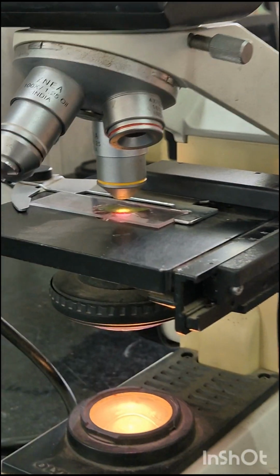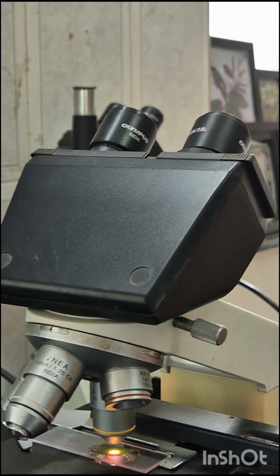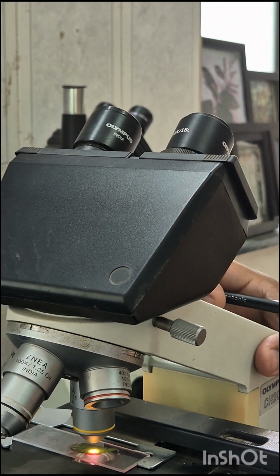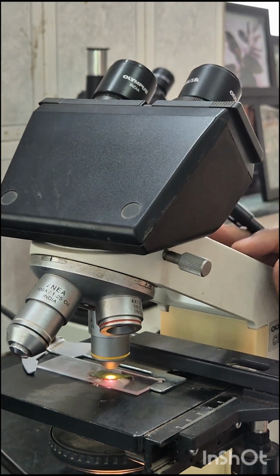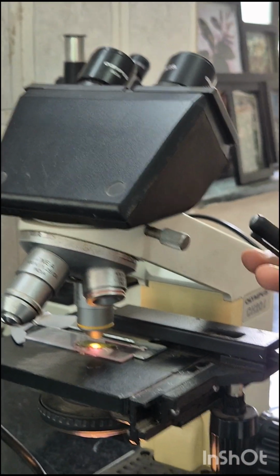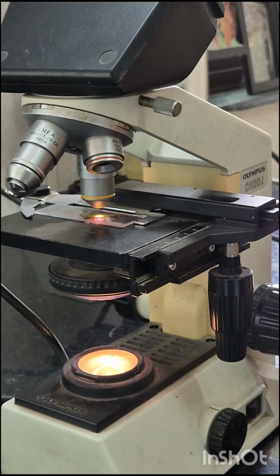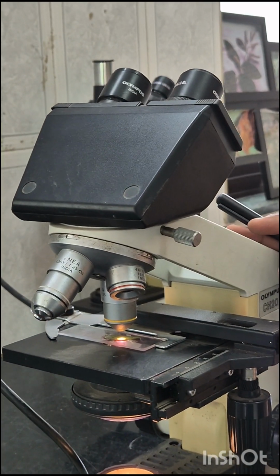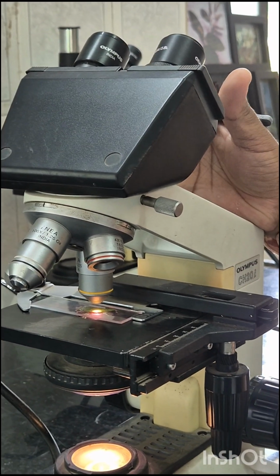While passing through the objectives, the transmitted rays are spread so that they appear to come from bigger objects. The light is then focused on the eyepiece lenses. This lens further magnifies the pre-magnified image coming from the objectives, and finally a highly magnified image can be observed through both eyepiece lenses.